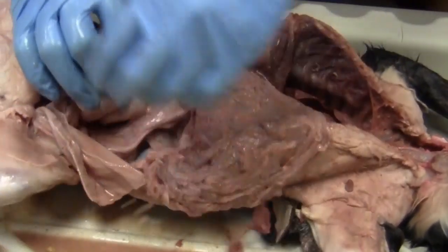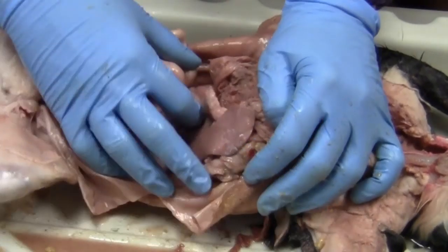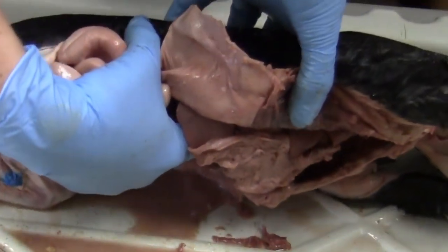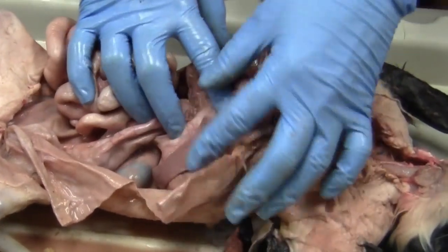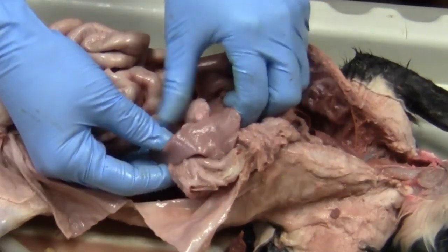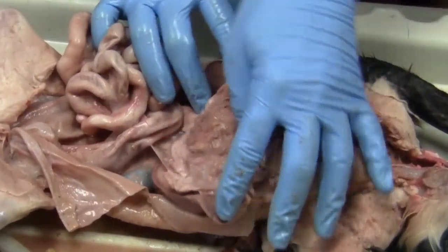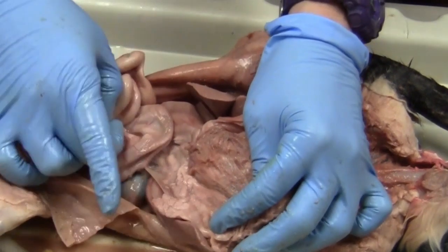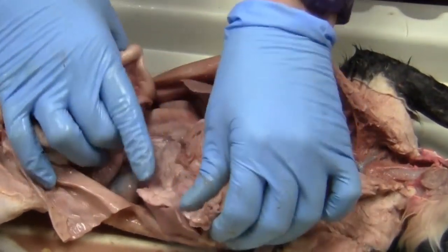Okay, so then we are going to move on to our spleen over here. It's this darker colored structure right here. And the cats, they're pretty large. Last semester we used rabbits, and their spleens were significantly smaller than the cats'. So we have a big spleen right here. And then just to the right, because, you know, cat's right, we're going to have our pancreas. The pancreas is this light colored structure right here. A lot of people say that it looks like brisket, which, you know, if you want to think about food when you're dissecting a dead cat, that's fine. But we have our pancreas right here.